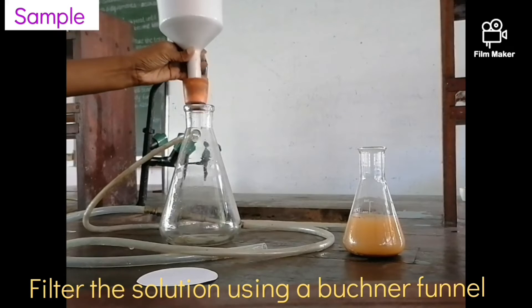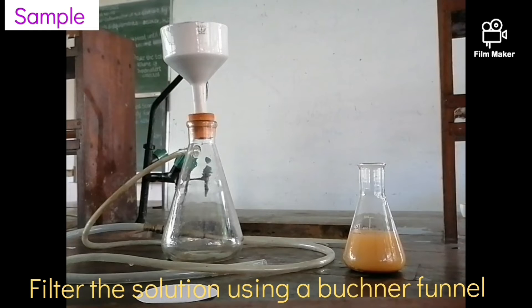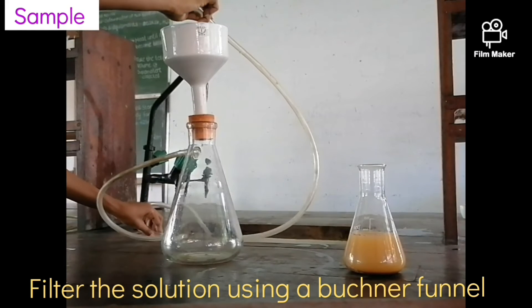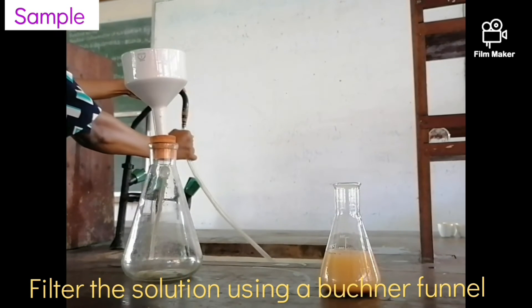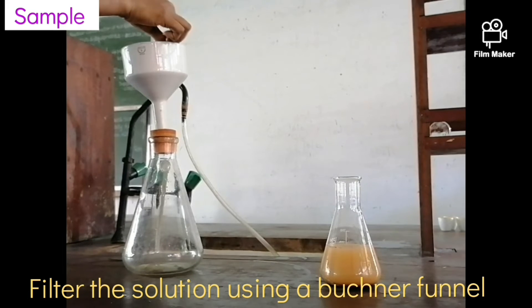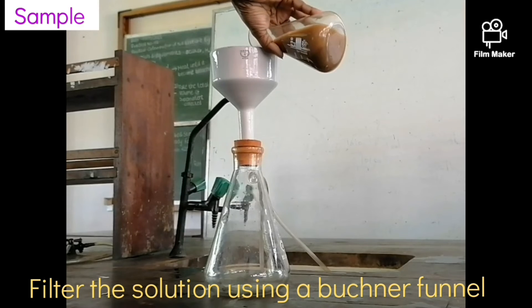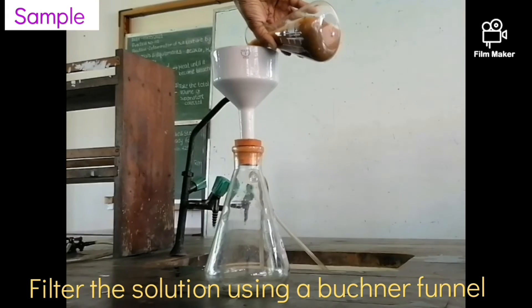Then filter the shaken solution using a Büchner funnel. We use vacuum filtration for a faster filtration process, using a perforated plate Büchner funnel and a side-arm flask. The side-arm flask is sealed with a cork and connected via a tube to a water aspirator, creating suction through the solution. The Bernoulli principle — technically referred to as the Venturi effect for a liquid — is activated. You must ensure a constant flow of water to continue the suction and filtration.